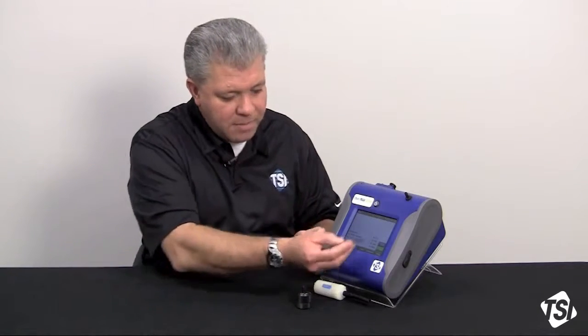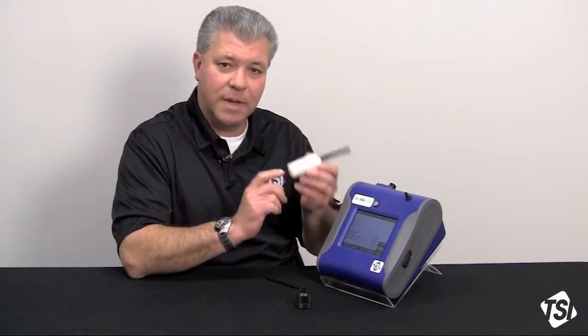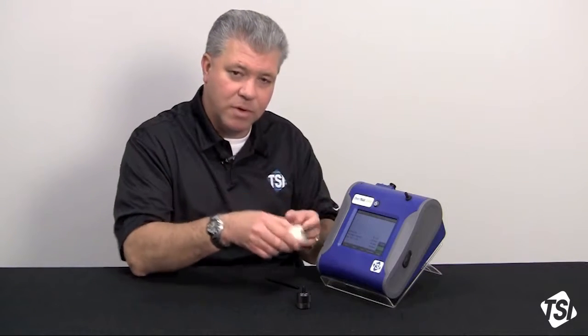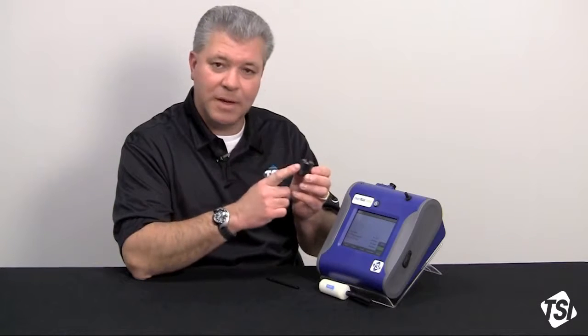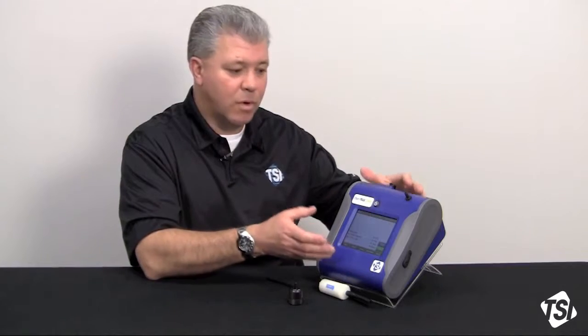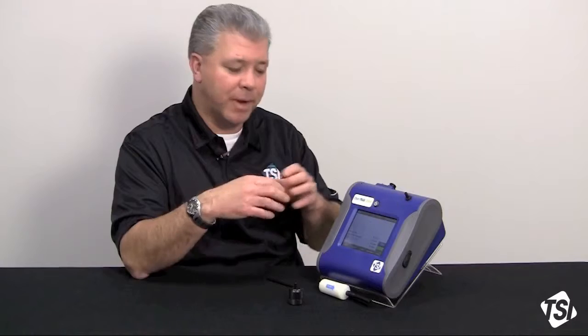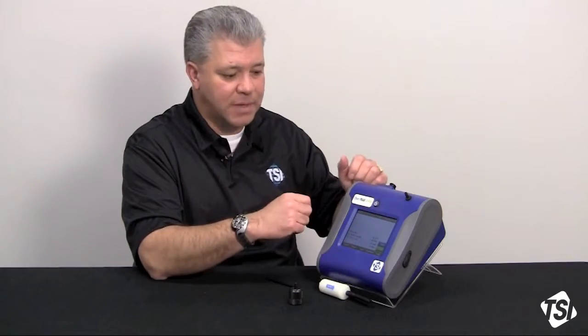How we're going to do this is very simple. We're on the main screen right now and we've already zeroed the instrument. That's something critical to do before you perform a size correction factor calibration. We also have a PM 2.5 impactor that has been greased up and is ready to go. Now let's assume we're doing this in the work area or ambient area where we're going to do our sampling, and we're concerned that the aerosol we're going to measure may respond differently than the Arizona road dust — the A1 test dust.